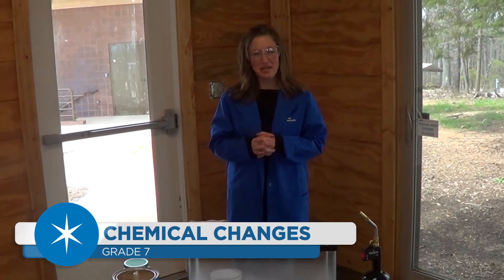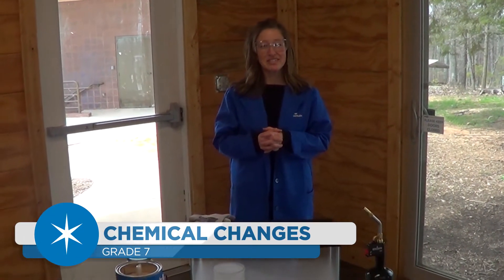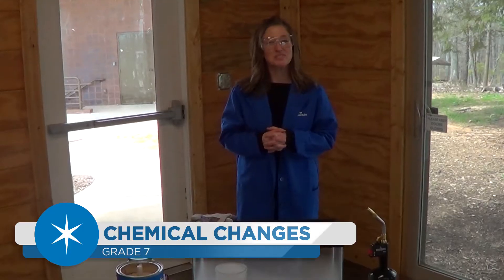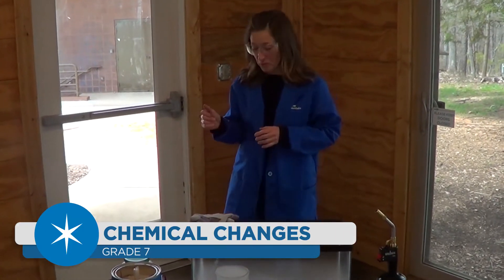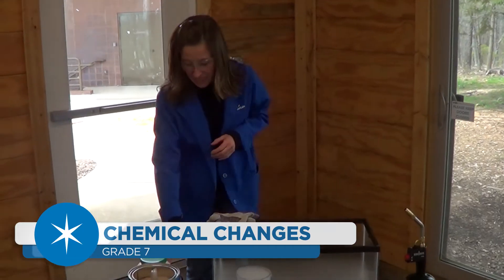Hi everybody, Val Mosier here from Rupert Mountain Science Center. Today we're going to explore some chemical changes and chemical properties.